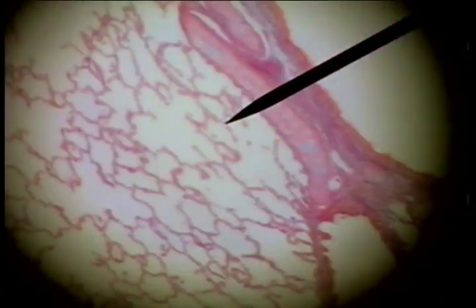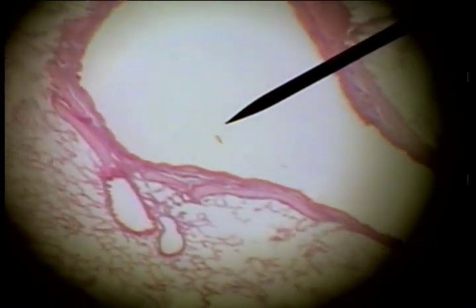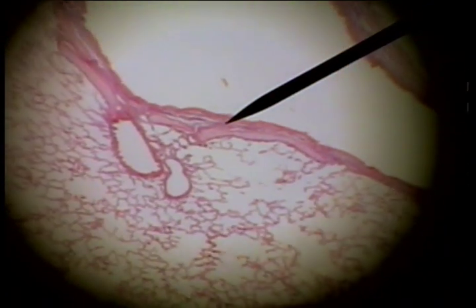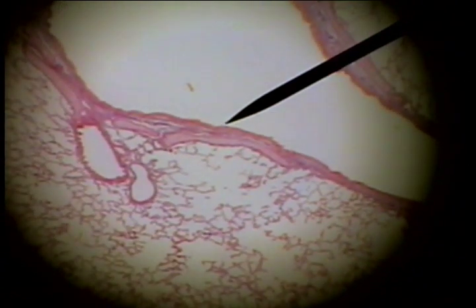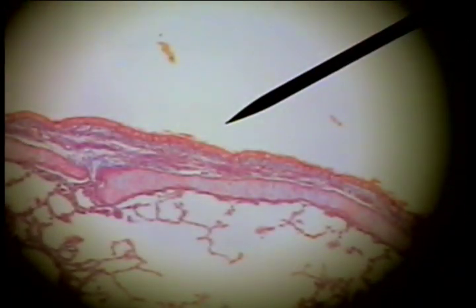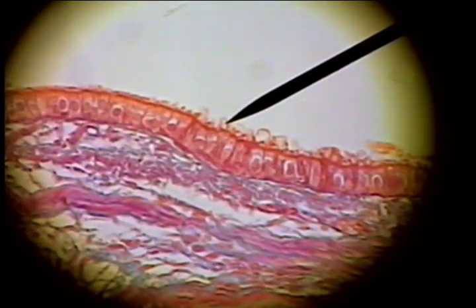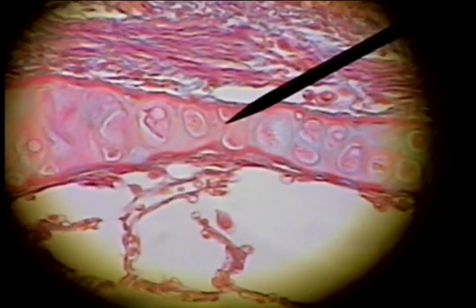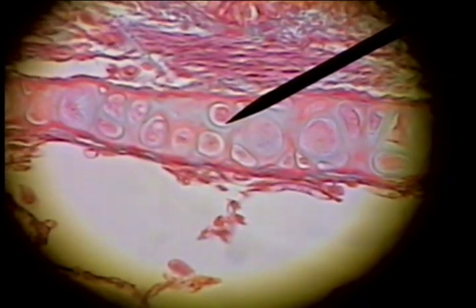Looking further, we'll see a larger structure. We'll go to scanning to see that — here's a large airway, and this large airway would be a bronchus. It would be characterized by pseudostratified ciliated columnar epithelium and hyaline cartilage in the wall. The epithelium is recognized by the fact that the nuclei are at different levels and there are cilia on the top. The hyaline cartilage has its ground-glass blue appearance and the chondrocytes in the lacuna.